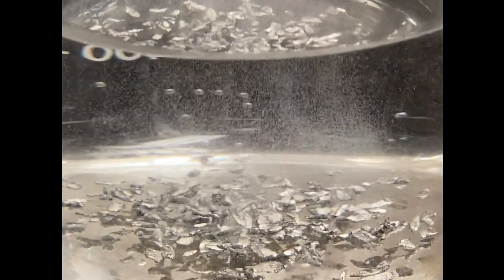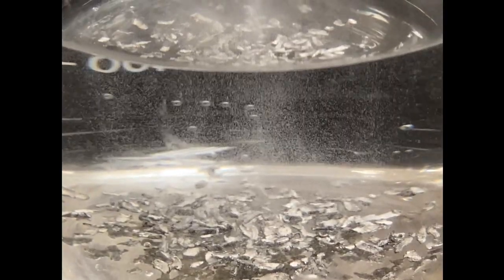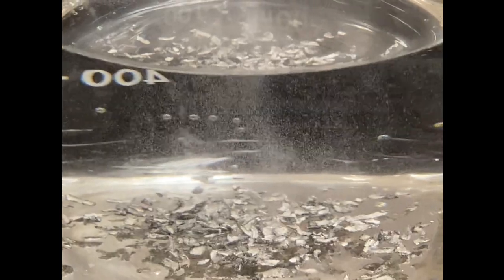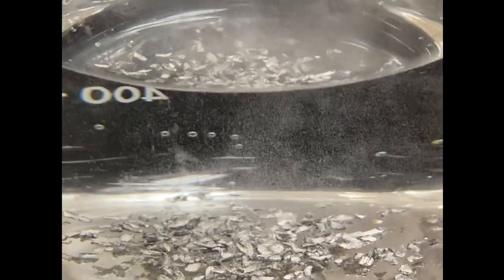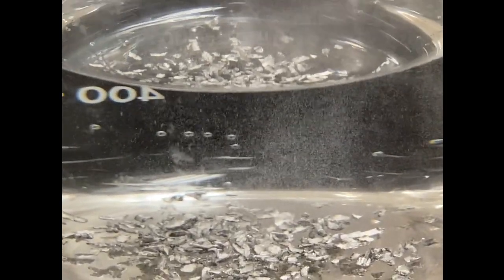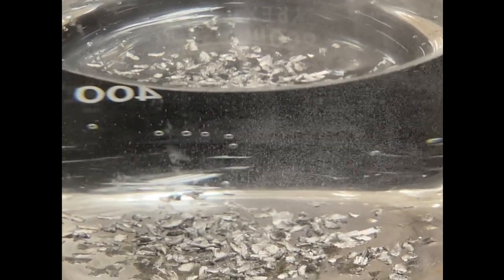Let's start. So now if you look at it, you're seeing it's bubbling. Now we had to use a little bit warmer water on this, otherwise it would take forever for you to see anything. So a little bit of cheating for video's sake. But it is reacting because you can see the bubbles coming up. Remember, a chemical reaction is occurring because of bubbles, and so it's forming a gas. Not a lot of it, but it is forming.